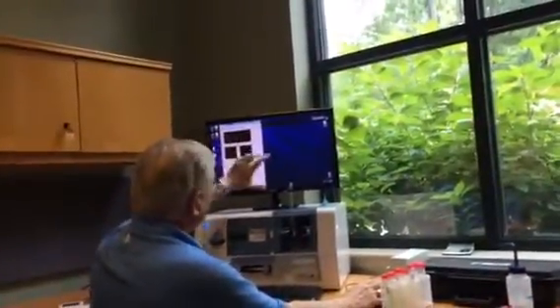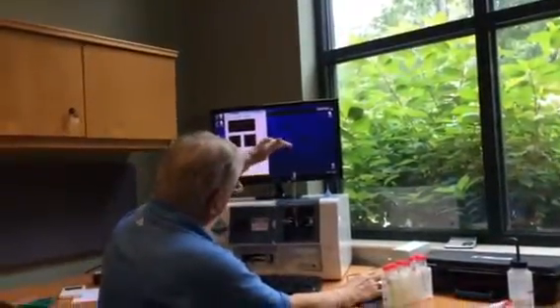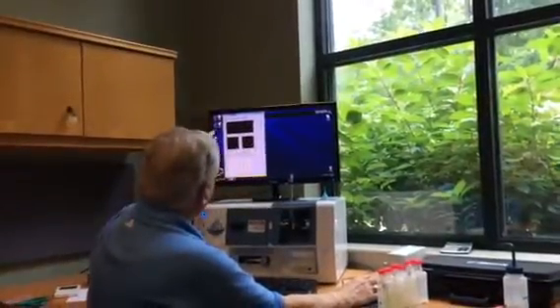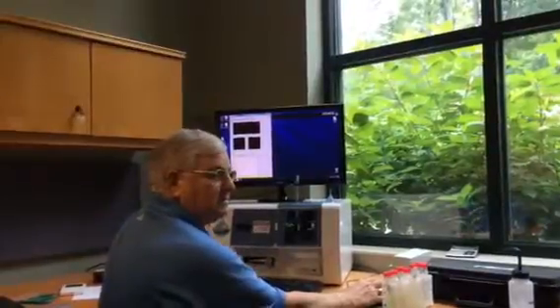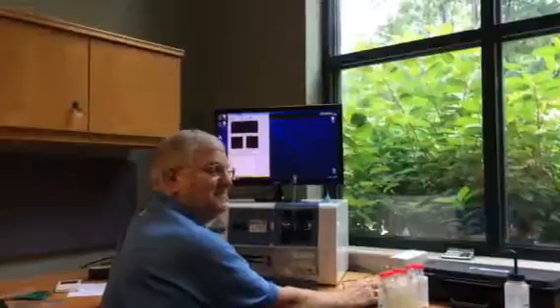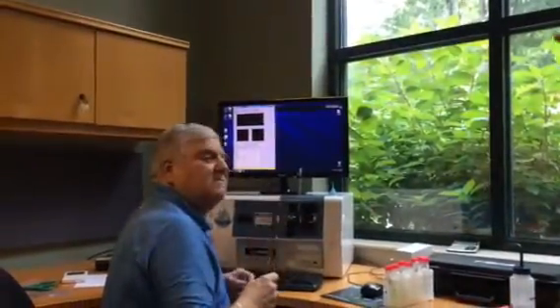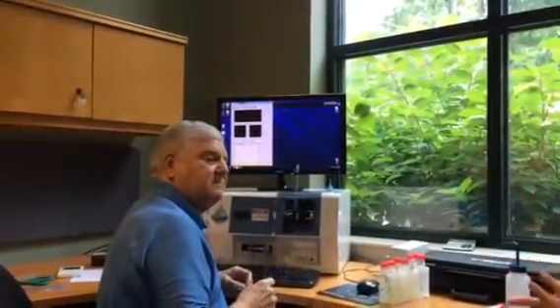Then I'm going to get the software to actually run that, but I need to get the pump to bring it down in here to start seeing it. Great. Right, and stop that, and then I can go into auto image and run it full time. Now you have a unique problem in that your sample settles so fast that, to have a high quality data run, I ideally want a pretty even distribution of particulate passing through the flow cell.